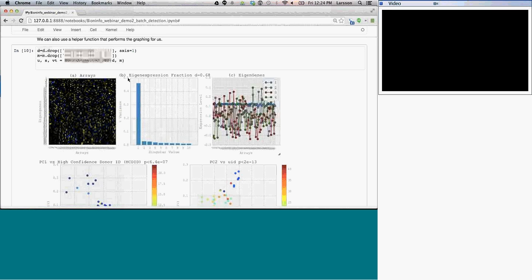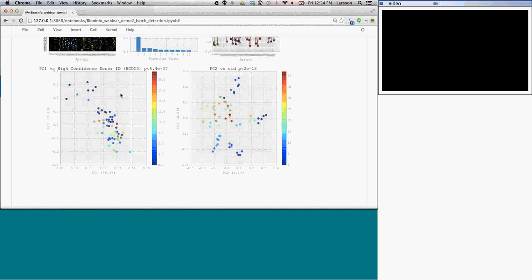And then the second figure shows the variance, or the amount of information, captured by each of the singular vectors. So this is what's in the S matrix. And then this plots the first few rows of the singular vectors as lines instead of just as a heat map. Then below we see the same kind of information that we saw before, the PC plots where we're plotting PC2 versus PC1. And here in percentages, you can find the amount of variance captured by each one.